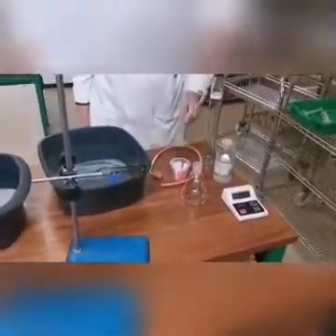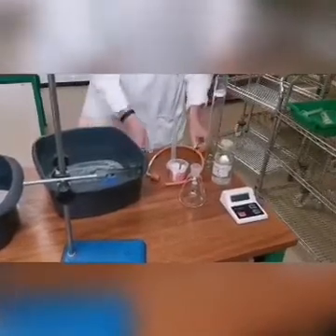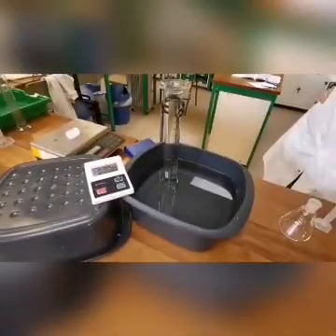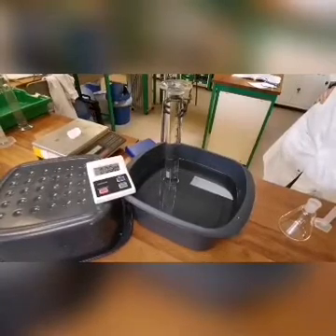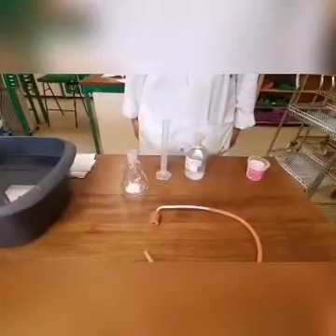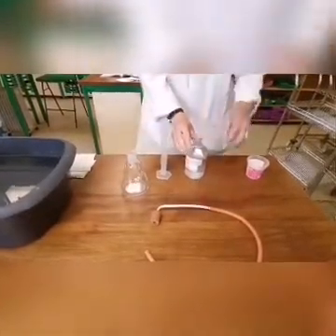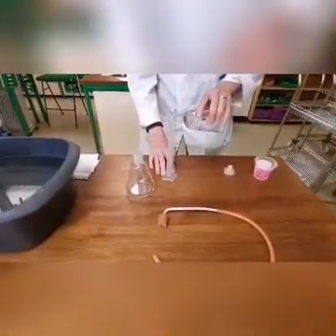measuring cylinder, a 250 cm³ measuring cylinder, a delivery tube, a water trough, clamp stand and a stopwatch. We filled the trough with water and then we filled the 250 cm³ measuring cylinder with water and inverted it into the trough. Use a 25 cm³ measuring cylinder to transfer 25 cm³ of 0.5 molar hydrochloric acid into the conical flask.